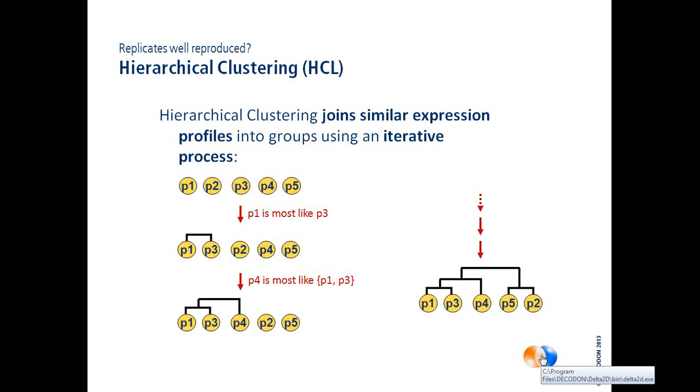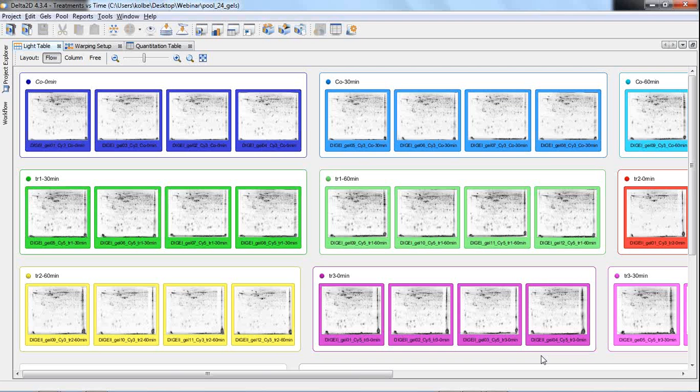Let me show this in Delta 2D. Here we go. In the light table, which is looking like the screen that I showed in my presentation, we see that we have 4 replicates for each combination. Here in the name of the group, we see this is the control group 0 minute factor combination, control 30 minute factor combination, and so on.